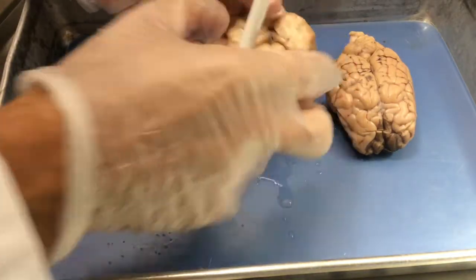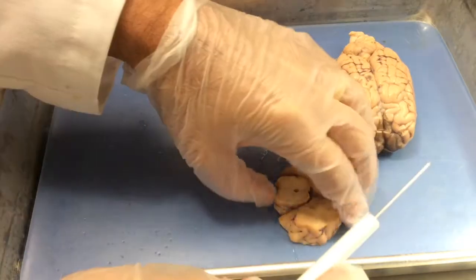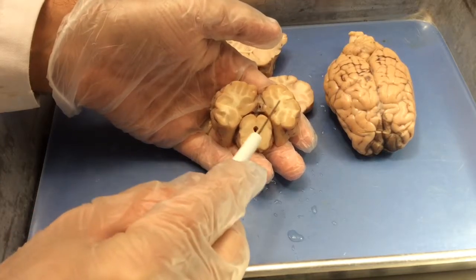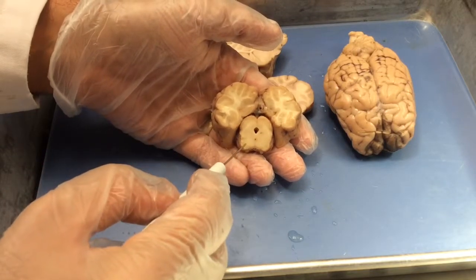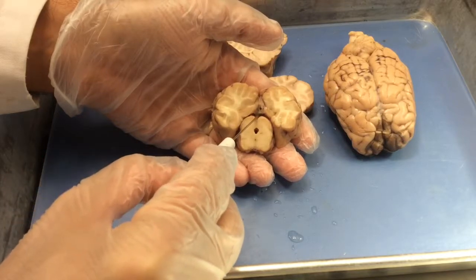So now that we're back as far as midbrain, the brainstem region is far enough back that this is overlying cortex. It's not connected to this region down here. All of this is midbrain. The midbrain is defined by a couple of landmarks.